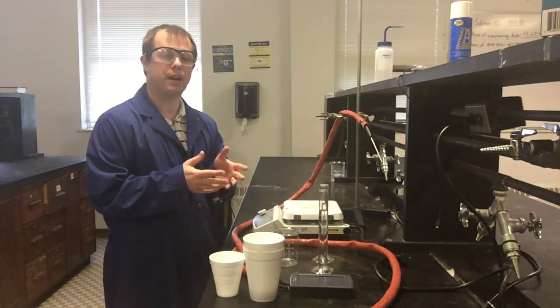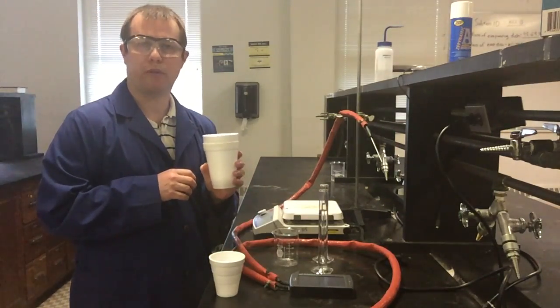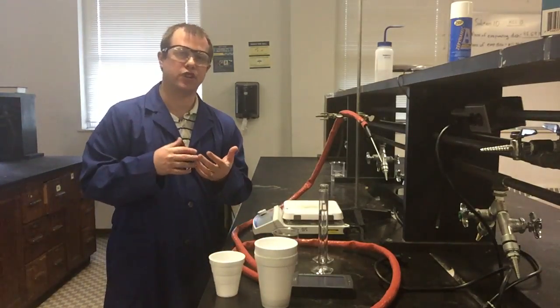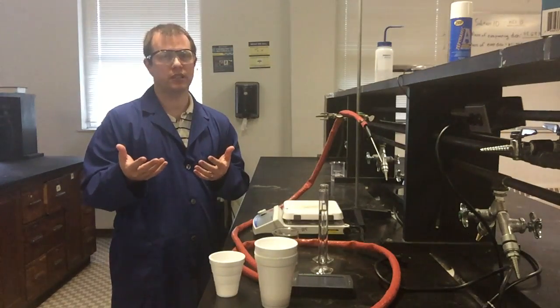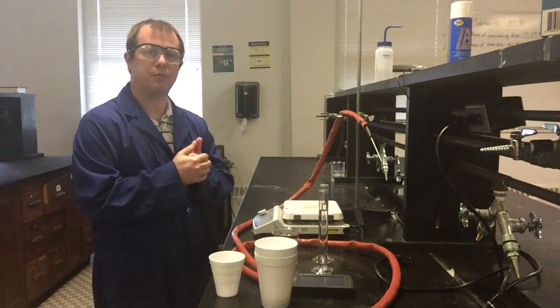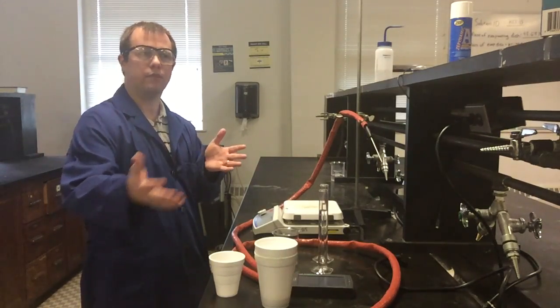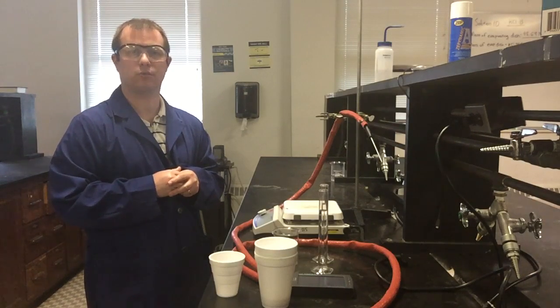We're going to be doing that by basically doing a reaction of an acid and a base in one of our styrofoam cups, similar to what we've used previously. And we're going to monitor the temperature change. And by monitoring the change in temperature of the water, we can hopefully get an estimate then of how much energy our reaction released. And then if we know the concentrations of our acid and base we reacted, a little bit of stoichiometry can help us figure out how many moles are reacted, and now we can figure out the energy released per mole. It's kind of the path we're going to try to take to figure out how much energy these neutralization reactions are releasing.